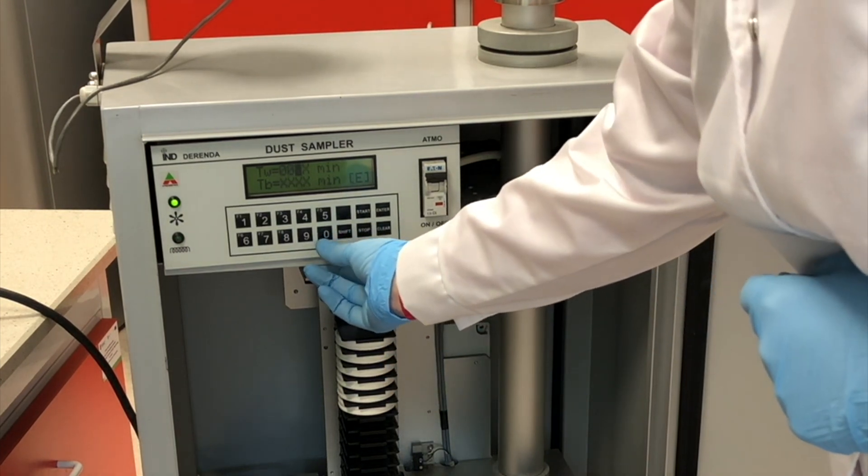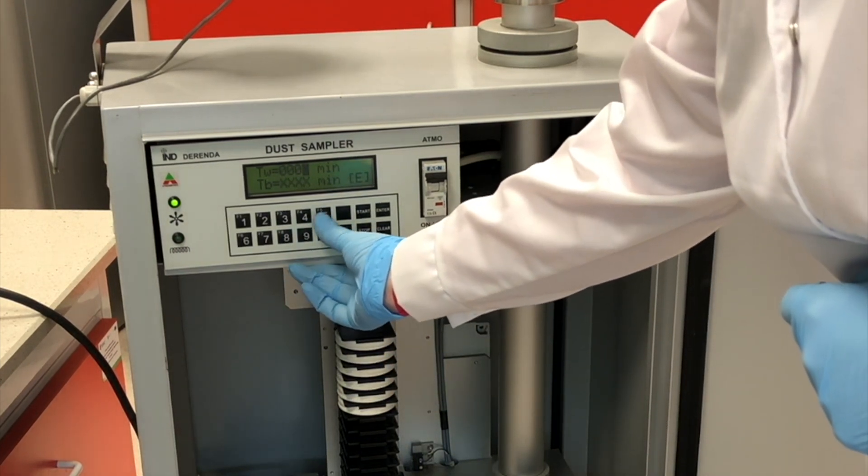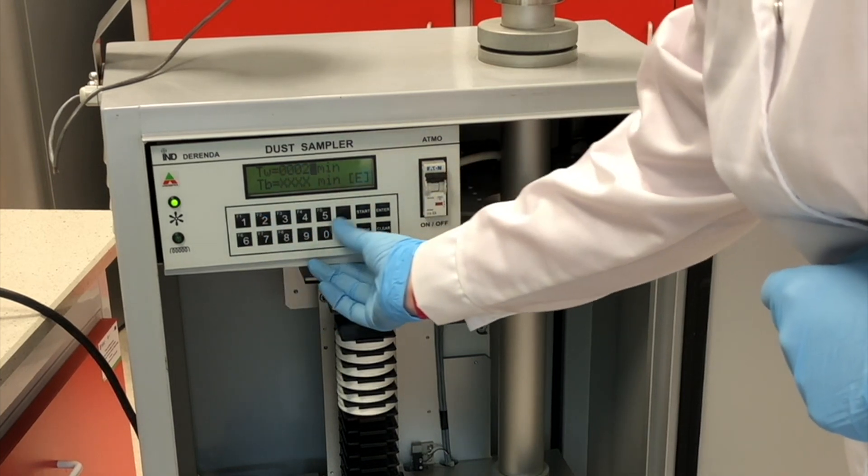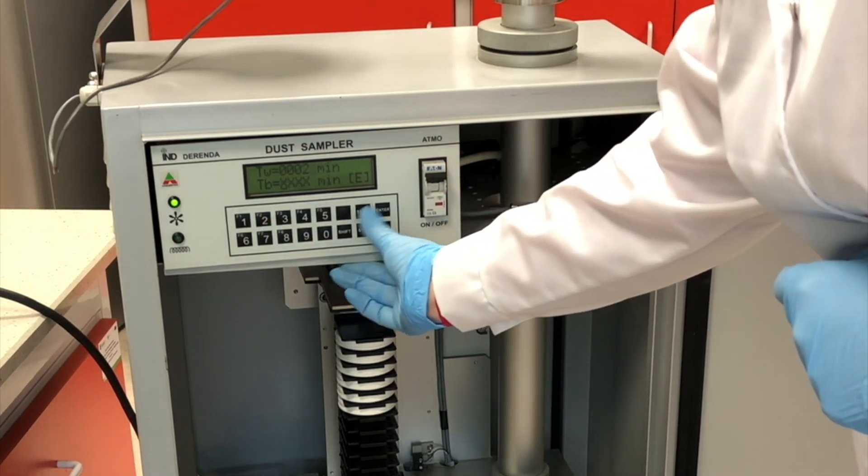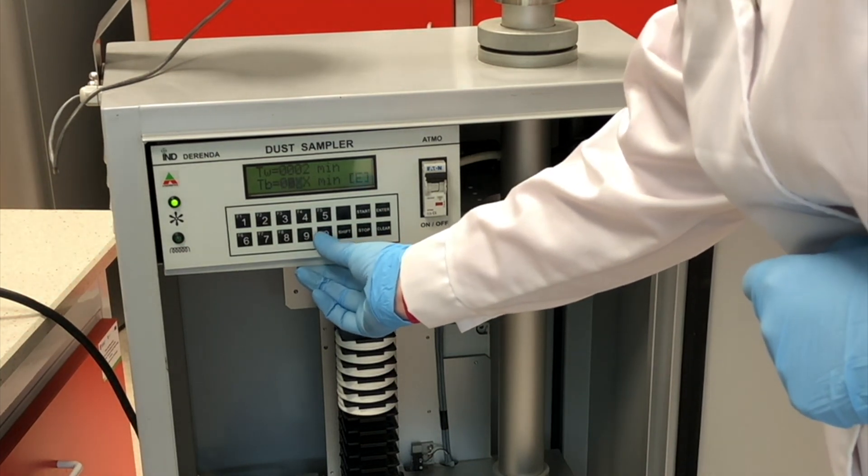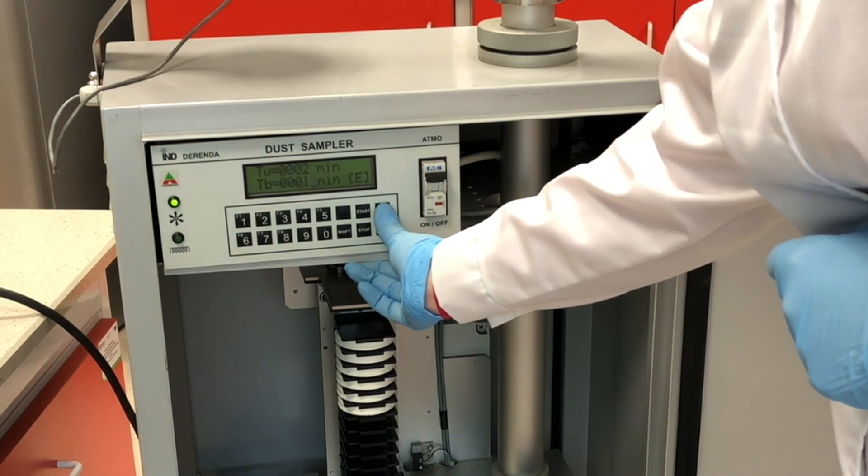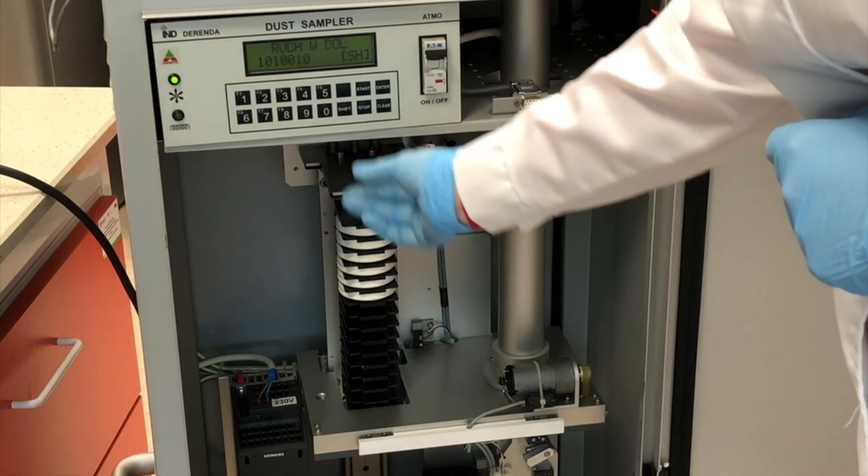We will take only the short time to show you how the filters are changing. So we will put here, for example, 2 minutes of work. And 1 minute of break. Also, we have to confirm by enter.